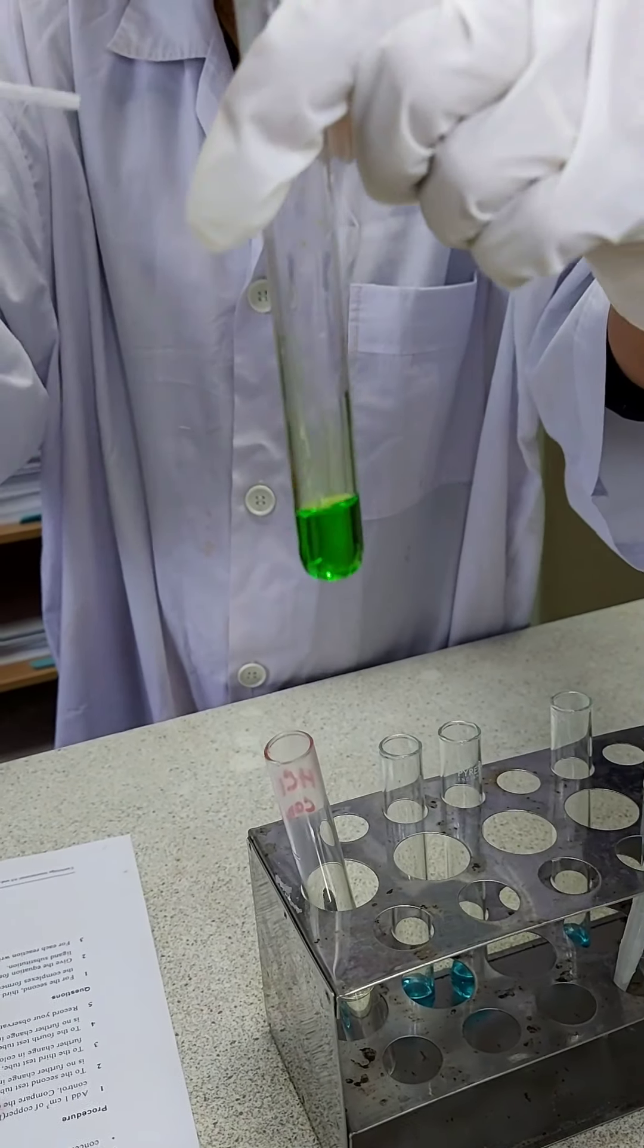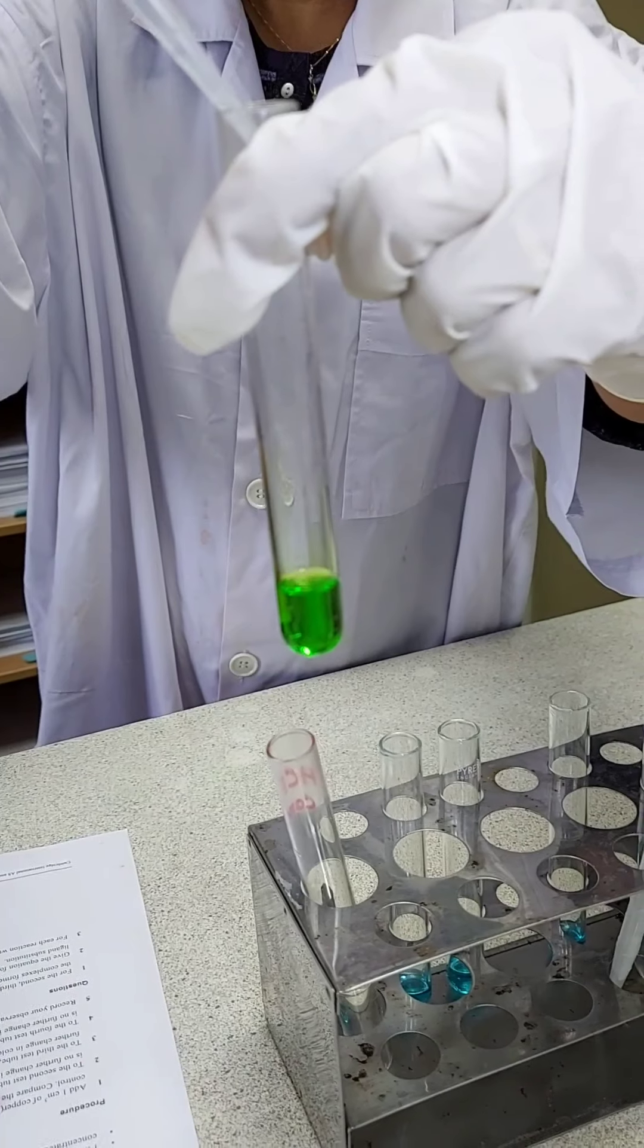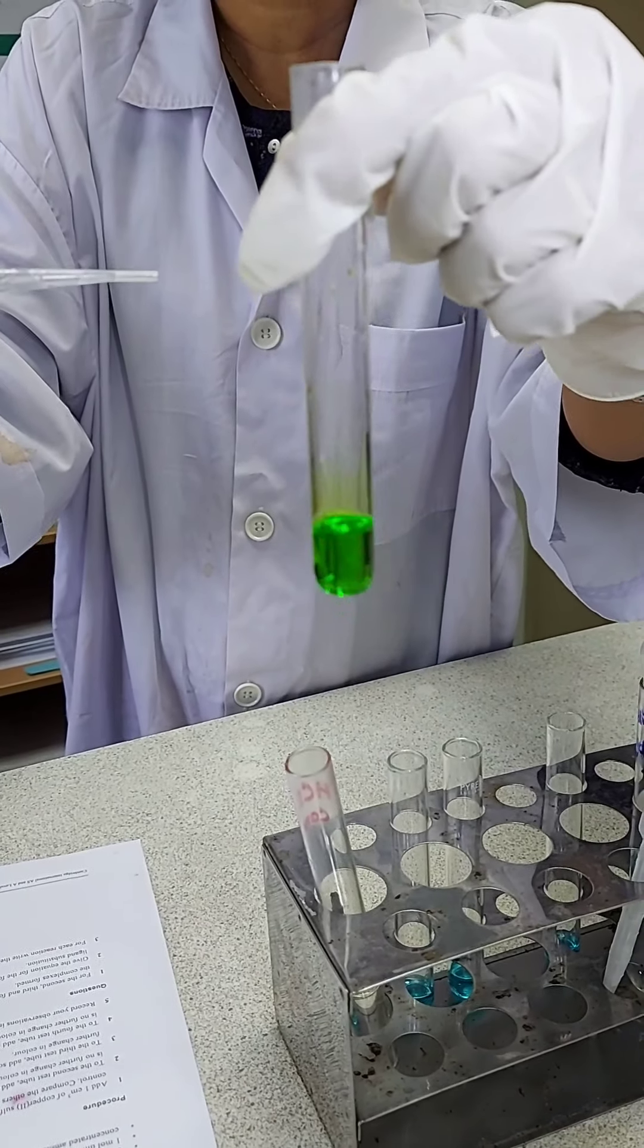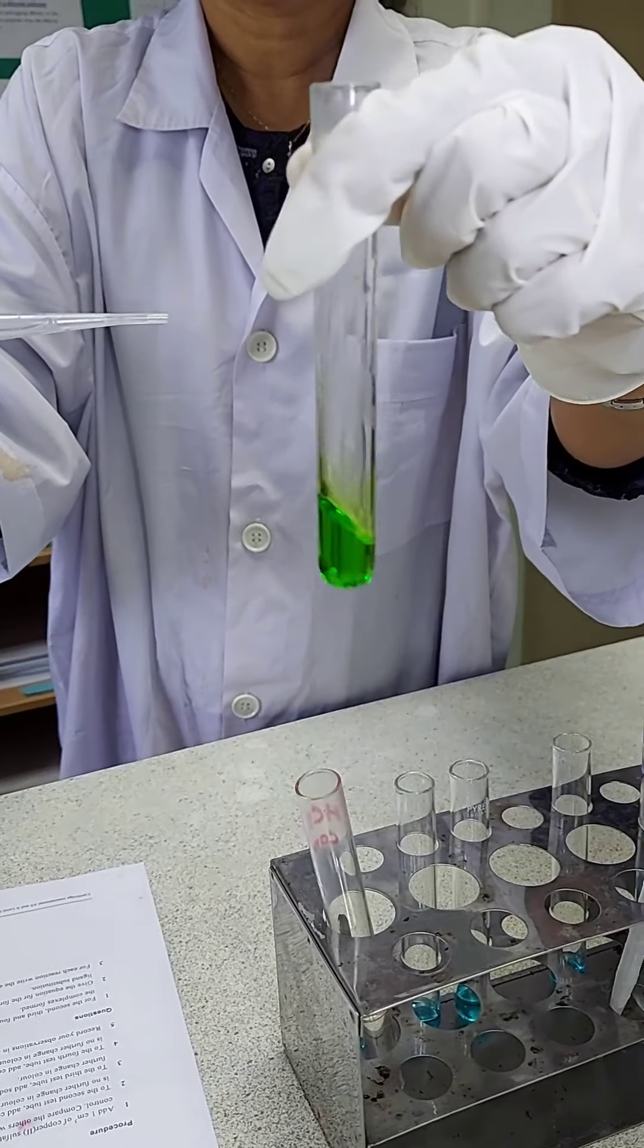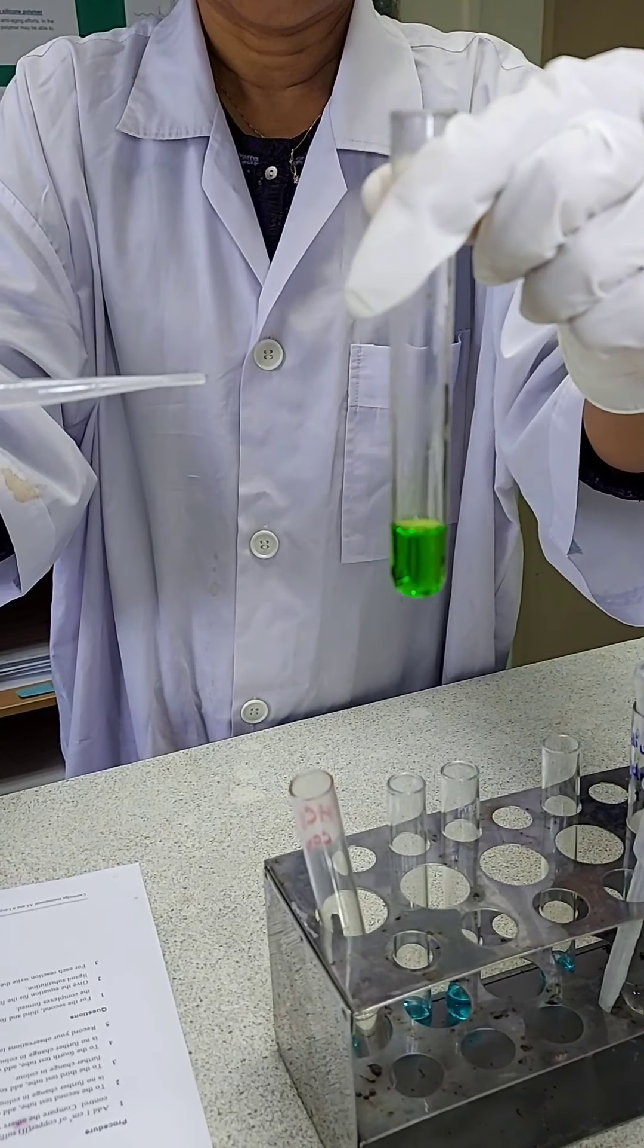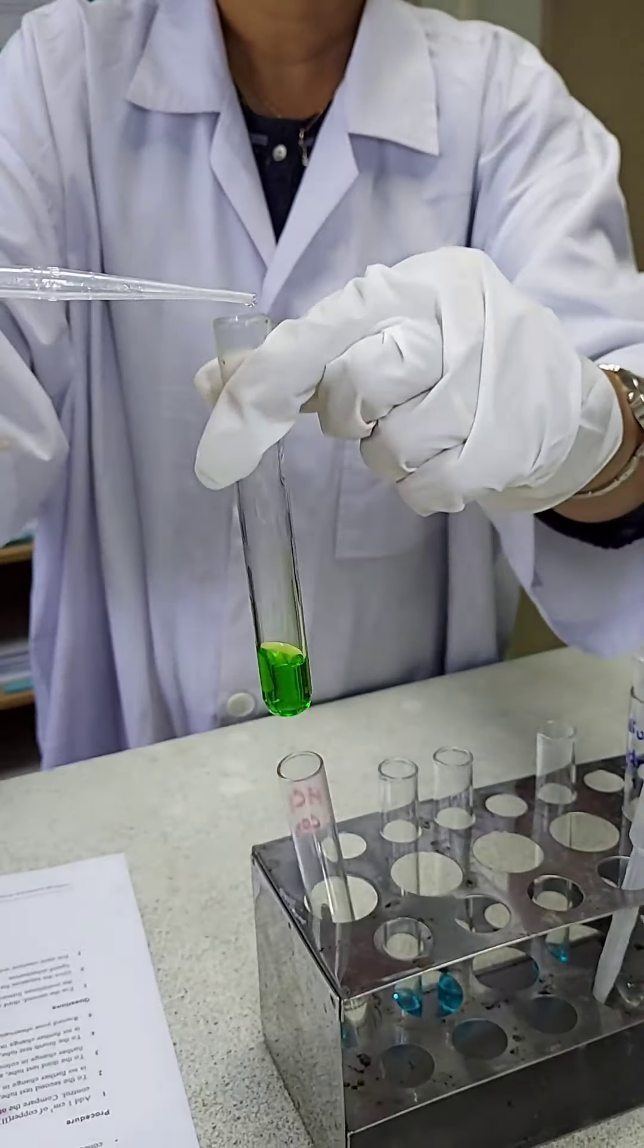I don't see any further change in the color, so I keep adding the hydrochloric acid till there is no change in the color.